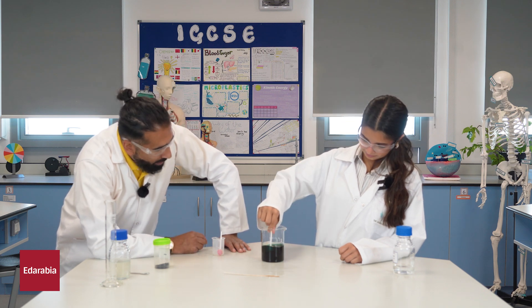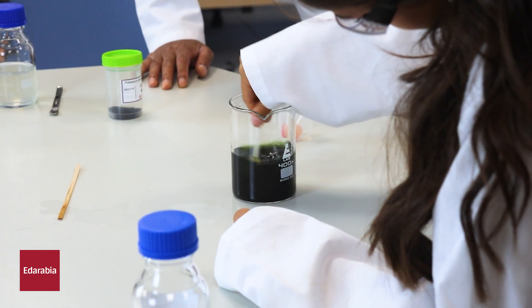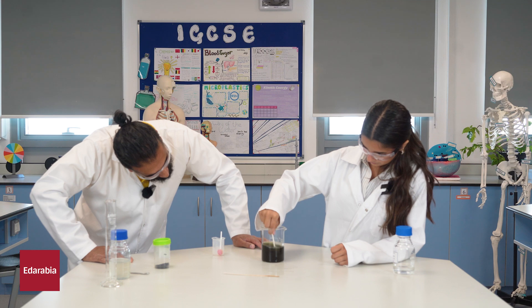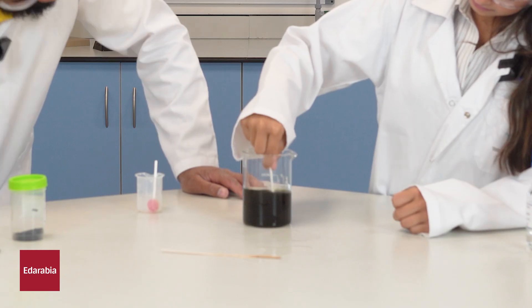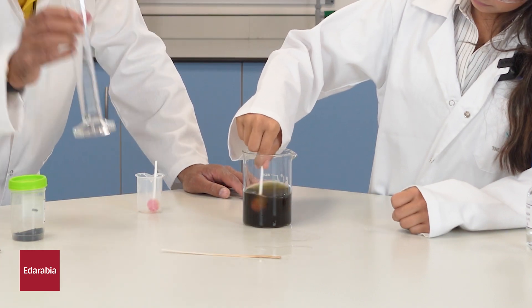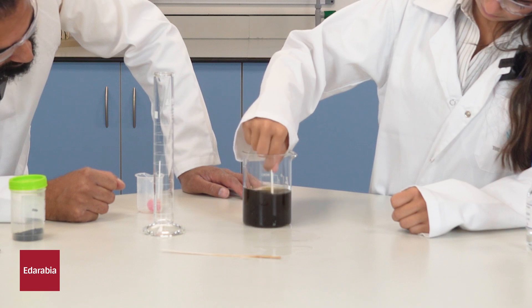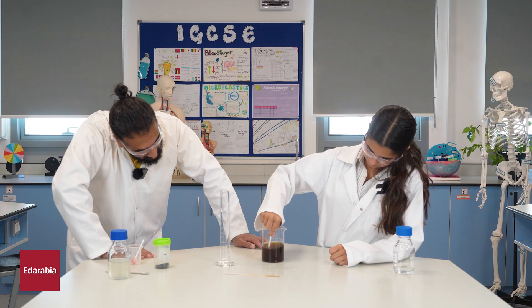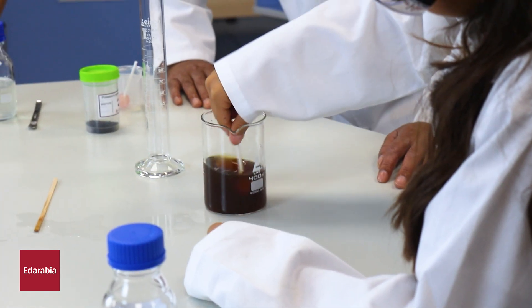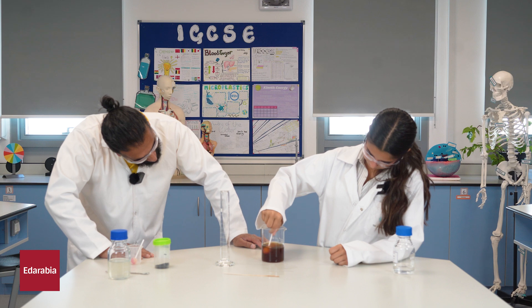Keep going. How much of the lollipop's left? Okay, some of it's gone. It's turning yellow — it is isn't it? So again we're starting to get that change, and maybe if we use this we might be able to pour some of the colours out to see the differences. Now sometimes we do get the final oxidation state plus two, but it can be tricky to get that reaction to go all the way, but we're definitely getting a change in colour.